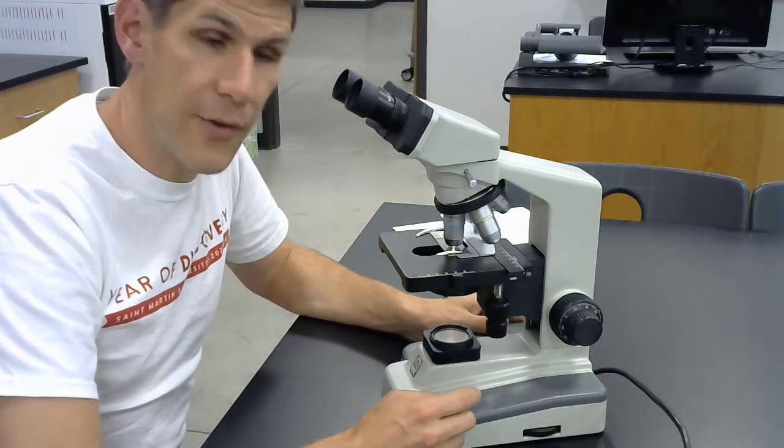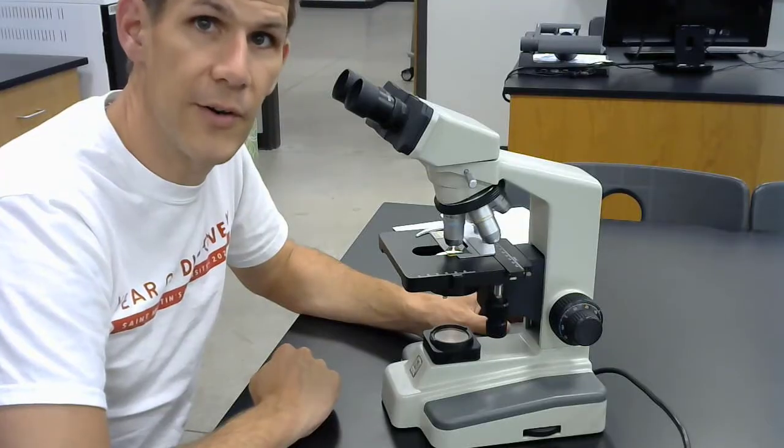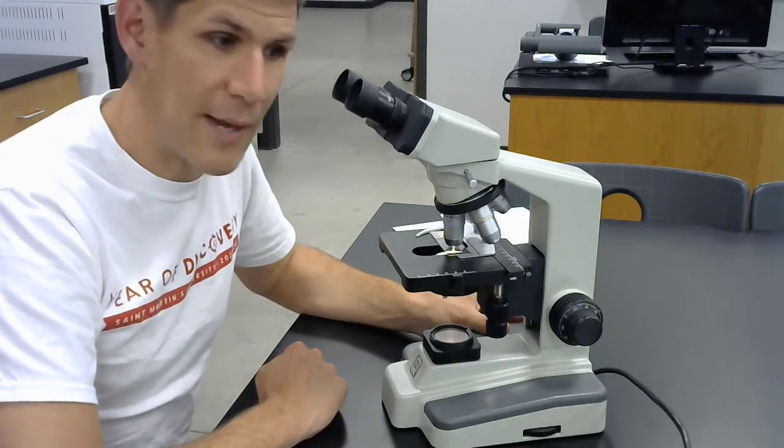At no point should there be resistance, because that can be the specimen pressing against the objective, and if you hear a nice crack, please report all breakages to your lab instructor.